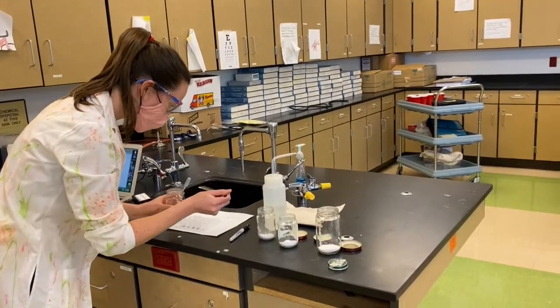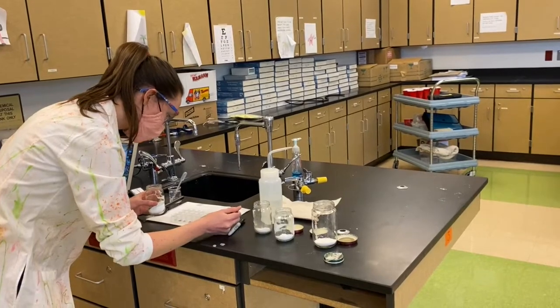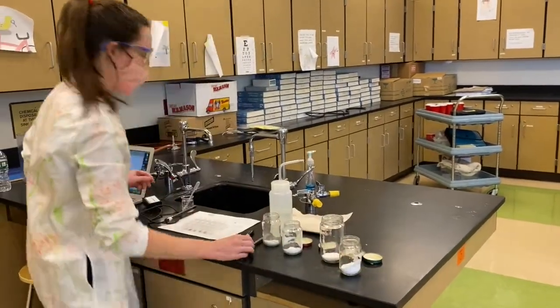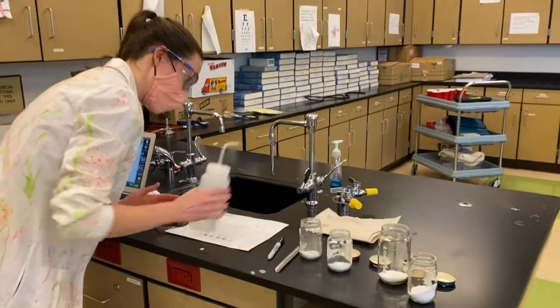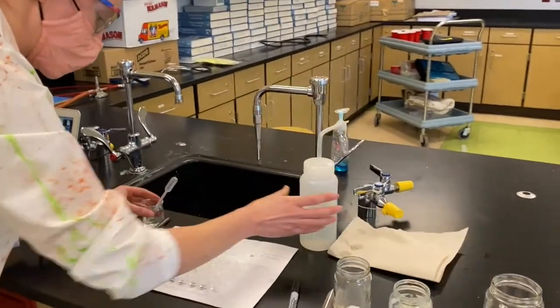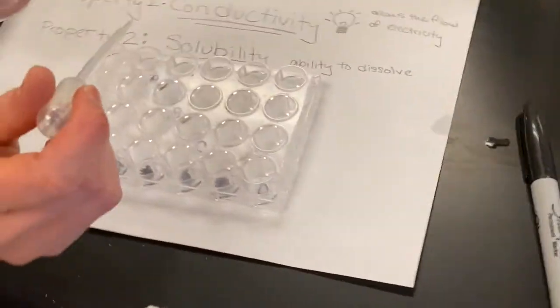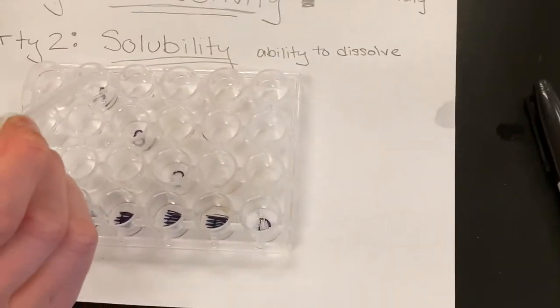Just a little bit. Okay. And dropper of water.